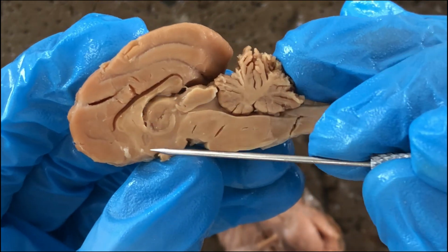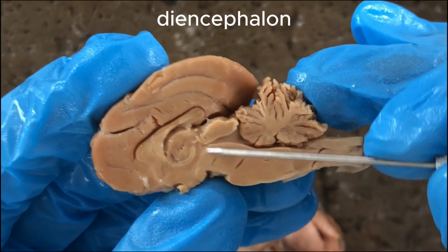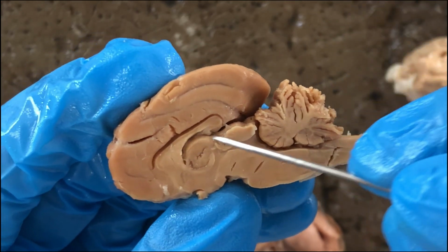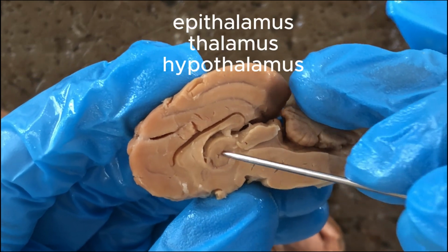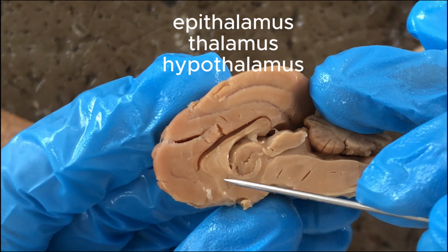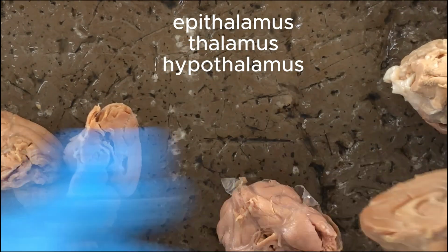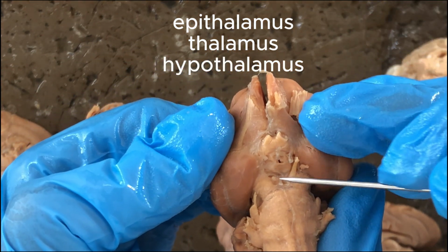Right, and this region here would be the diencephalon, which has three portions. The more dorsal one would be the epithalamus, the middle one would be the thalamus, and the ventral most portion of the diencephalon would be the hypothalamus, whose structures we have examined here in the ventral aspect of the brain.